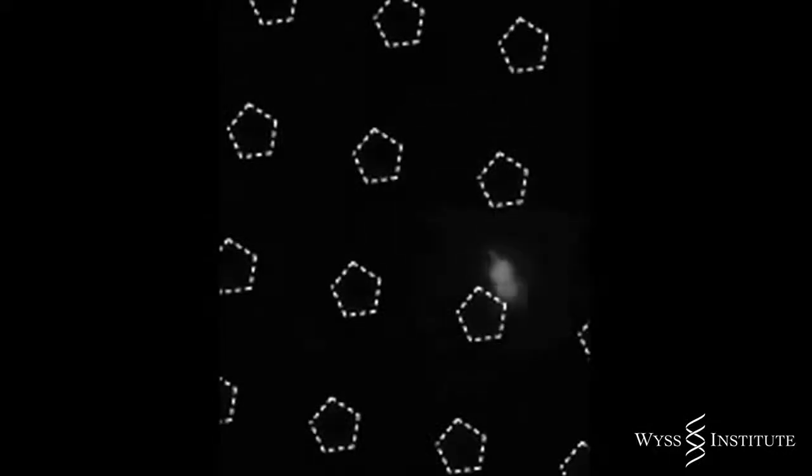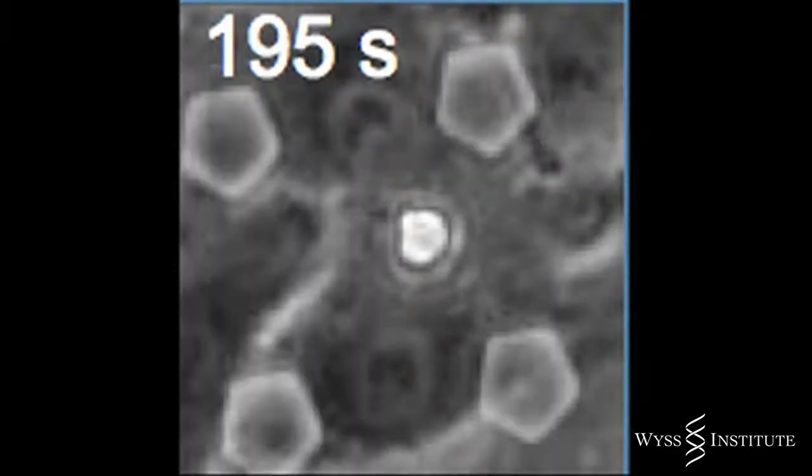Here's a magnified view showing a migrating white blood cell making its way through the first capillary cell layer, wriggling through the pentagonal hole in the flexible membrane, and then moving out of focus to the other side. When viewed from the air channel, with all cells visible, you can see a round white blood cell popping up from below. Just like in a real lung infection, the white blood cells, which are now colored red, engulf and kill the green bacterial invaders.